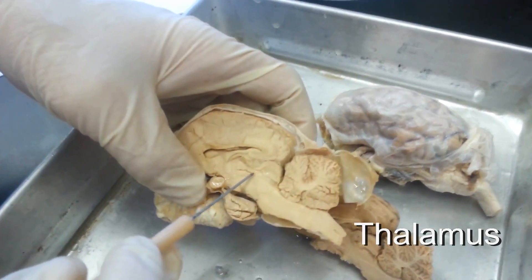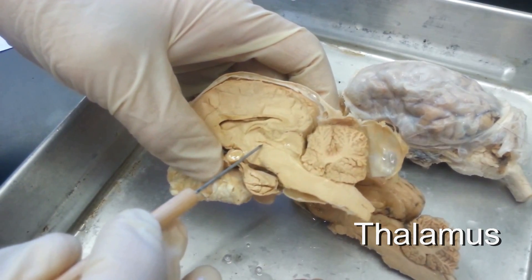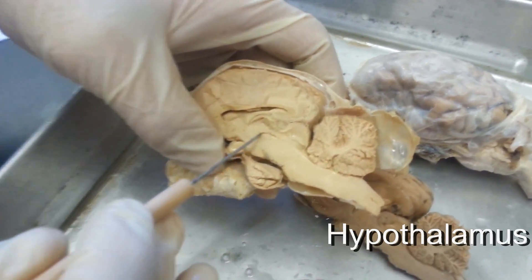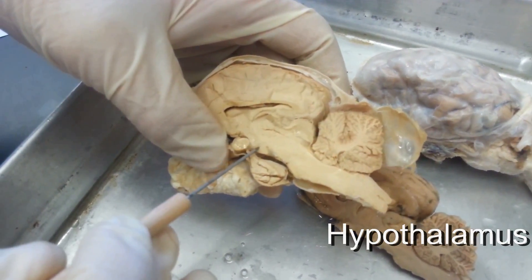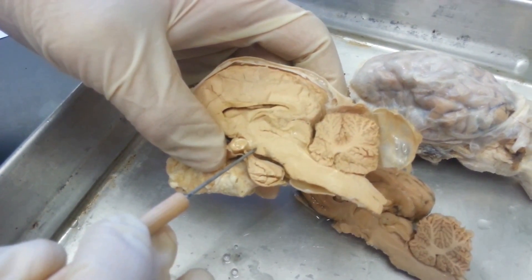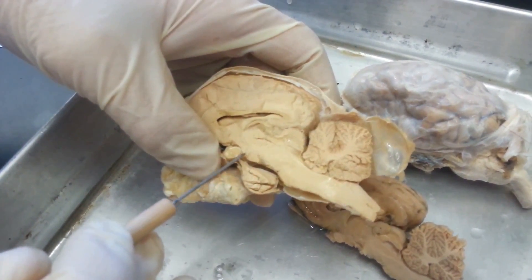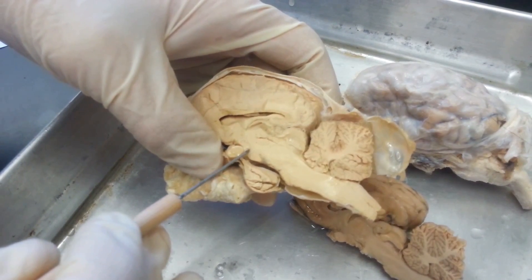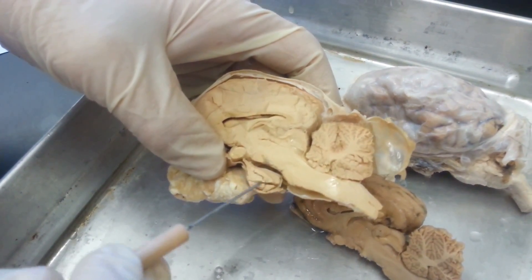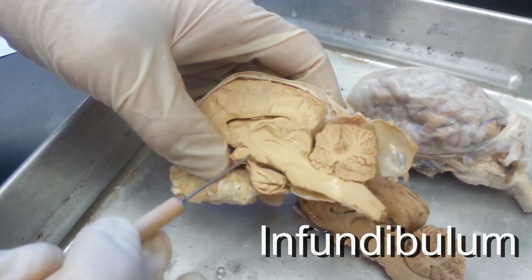The big structure in the middle here is called the thalamus. Below the thalamus is called the hypothalamus. And then the structure connecting the hypothalamus to the pituitary gland is called the infundibulum.